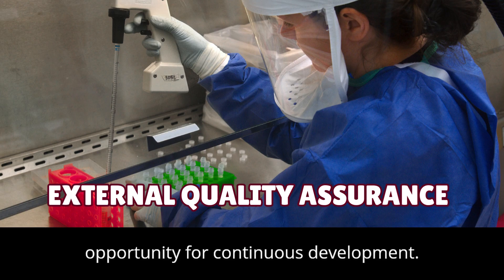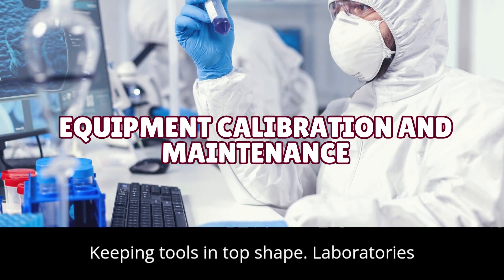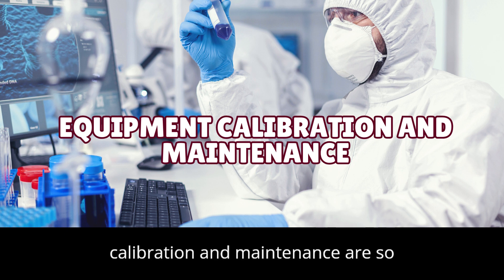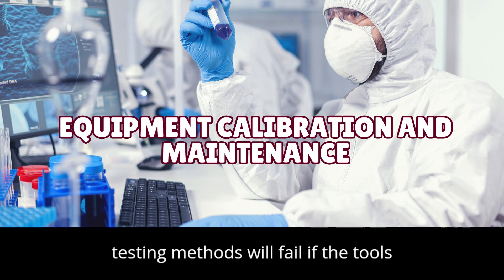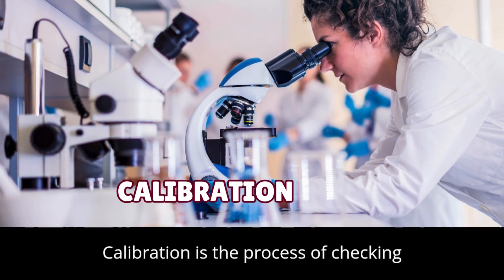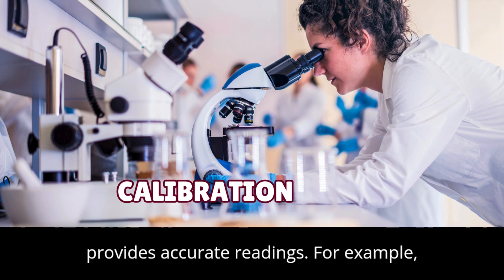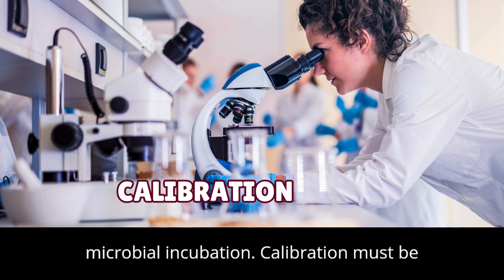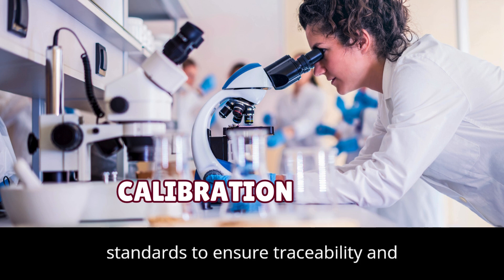Equipment calibration and maintenance — keeping tools in top shape. Laboratories depend on their equipment to deliver accurate results, which is why calibration and maintenance are so important. Even the best testing methods will fail if the tools used aren't functioning properly. Calibration is the process of checking and adjusting equipment to make sure it provides accurate readings — for example, thermometers and incubators need to be calibrated regularly to maintain the correct temperatures required for microbial incubation. Calibration must be performed against certified reference standards to ensure traceability and accuracy.